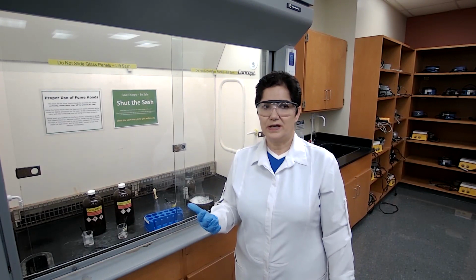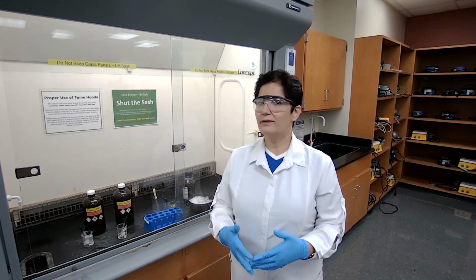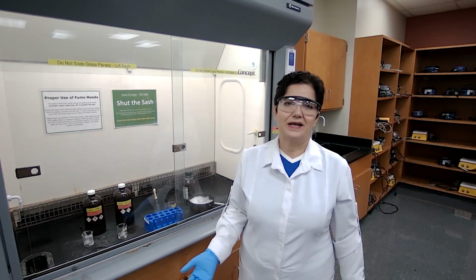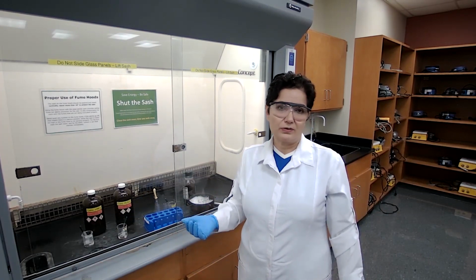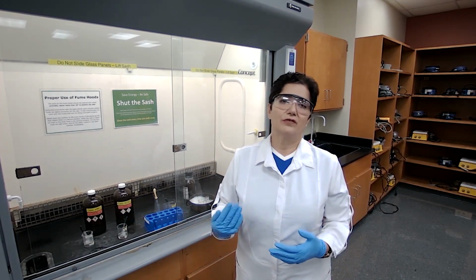If it's an electron withdrawing group, it is going to be a meta director. If it's an electron donor group, it is going to be an ortho-para director. I always tell students, if you already know this in theory, what's the purpose of doing the experiment in the lab? You know that methyl benzoate carries an electron withdrawing group, so the product is going to be meta. When we perform this experiment in the lab, the final product needs to be confirmed.